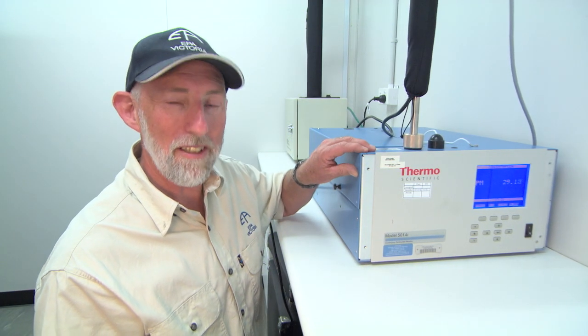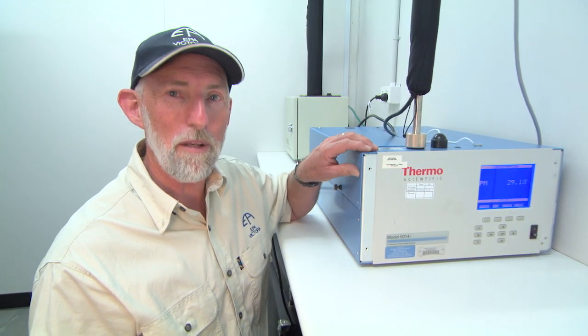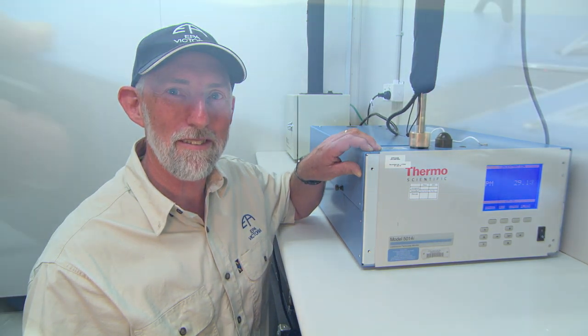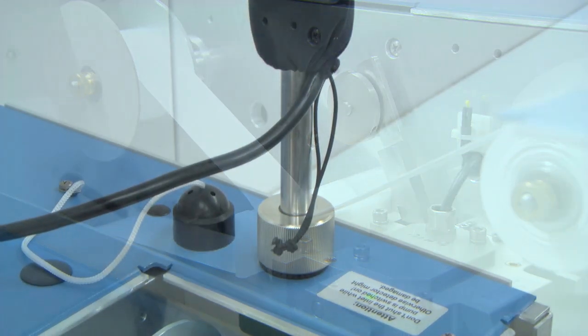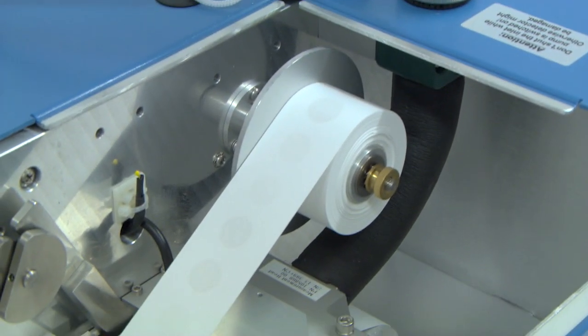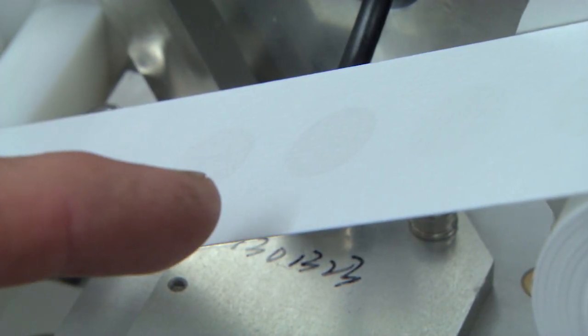The instrument here is a beta attenuation monitor. It measures those tiny particles I mentioned earlier. Inside this instrument is a roll of tape. The particles which come down the inlet are deposited on the tape. As you can see, when these tiny particles land on here, the tape can sometimes change colour.